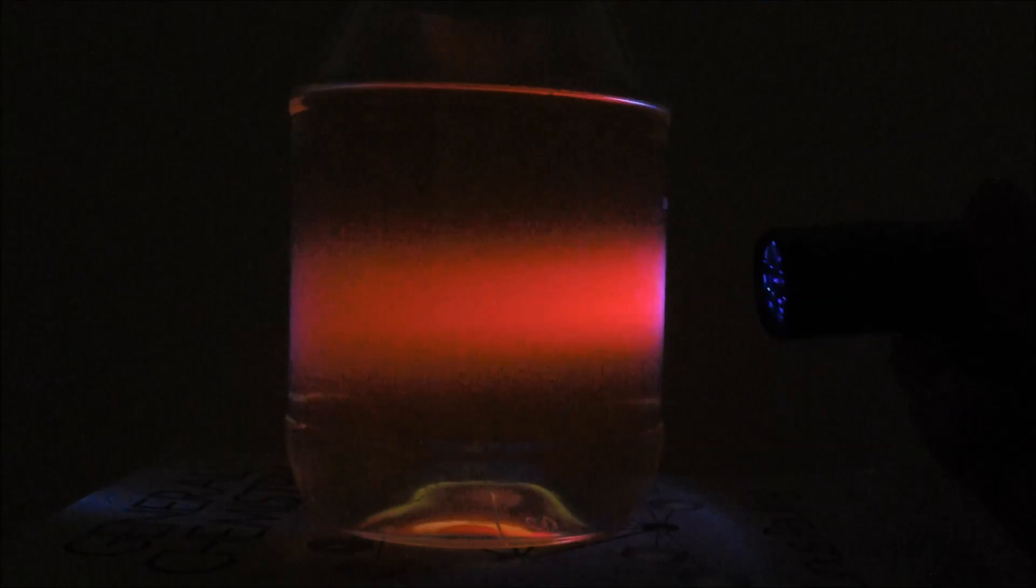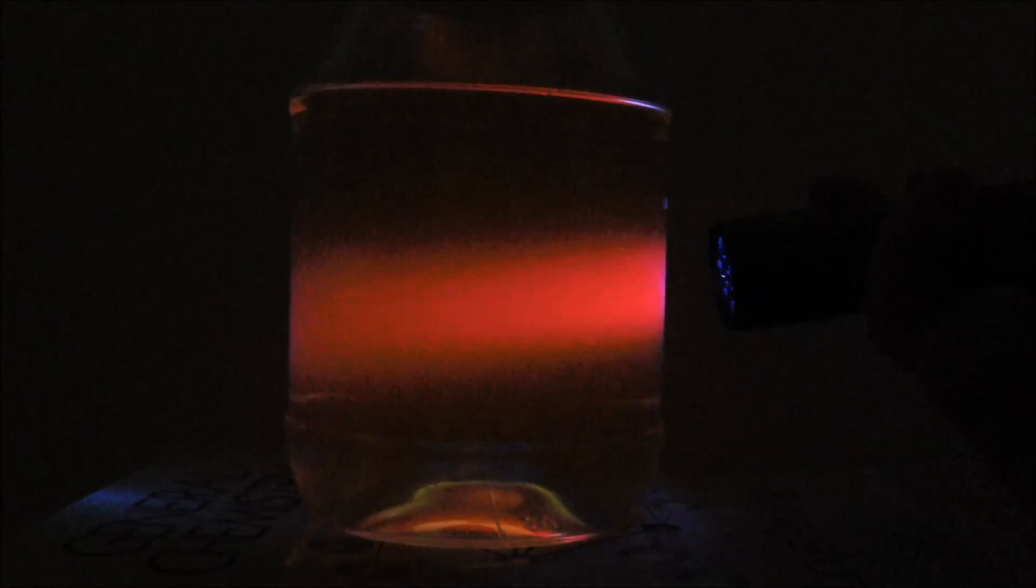This is a nice, simple demonstration of the fluorescence of chlorophyll. It's very easy to do. You do need a black light. I got mine from Educational Innovations.